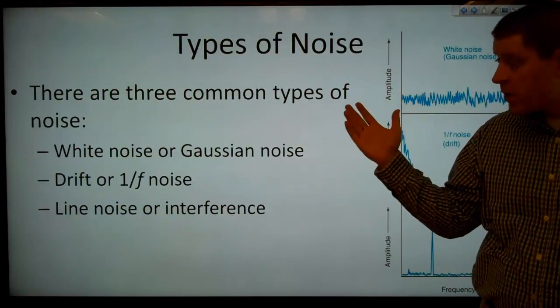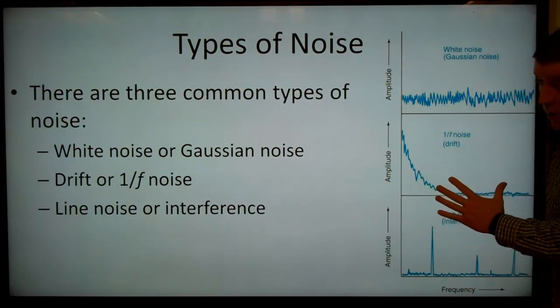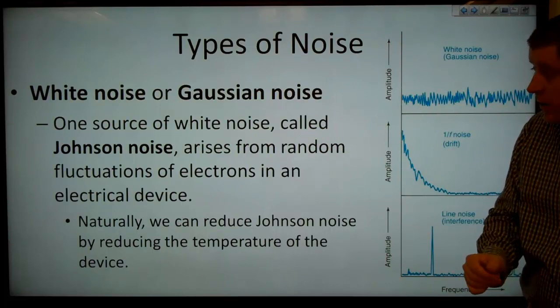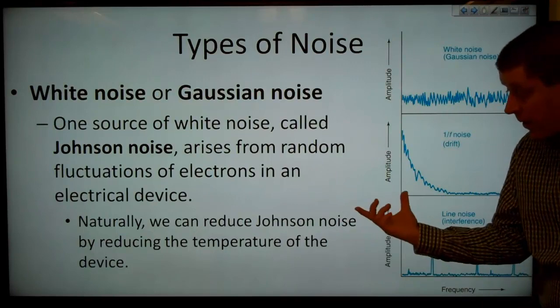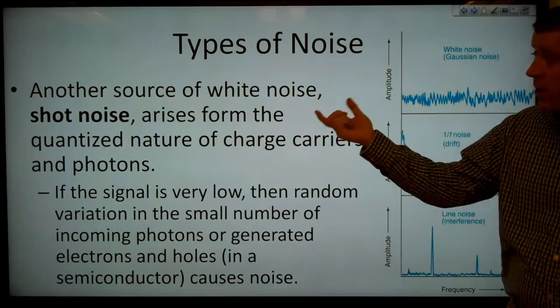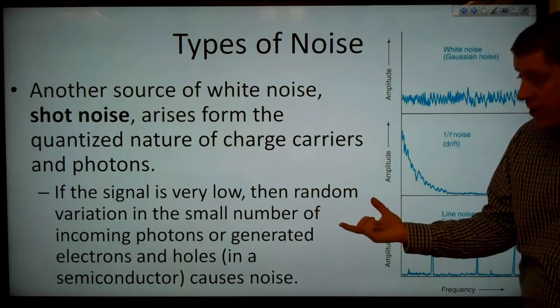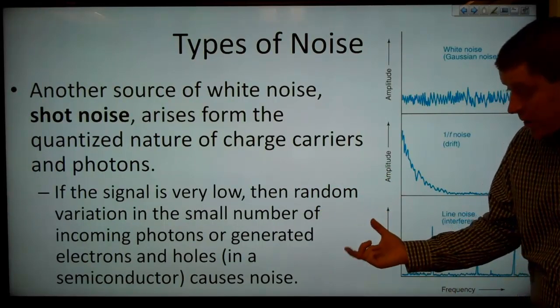So there are 3 common types of noise. We've got white noise, or Gaussian noise, which we show up here. We've got drift, or 1/f noise, which we show here. And we've got line noise, or interference, which we show there. So let's look at white noise, or Gaussian noise. One source of white noise, called Johnson noise, arises from random fluctuations of electrons in an electrical device. So naturally, we can reduce the Johnson noise by reducing the temperature of our device. Another source of white noise, called shot noise, arises from the quantized nature of charge carriers and photons. That is, if the signal is very low, then random variation in the small number of incoming photons or generated electrons and holes in a semiconductor causes noise.